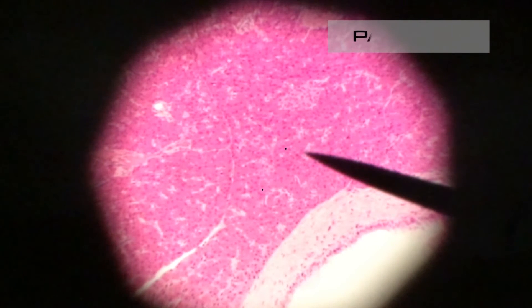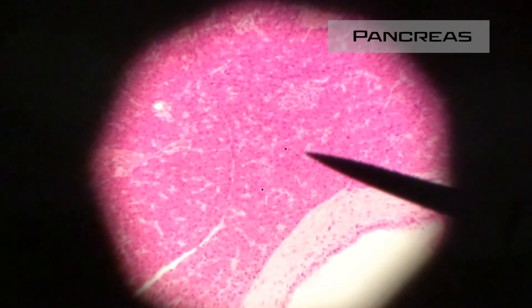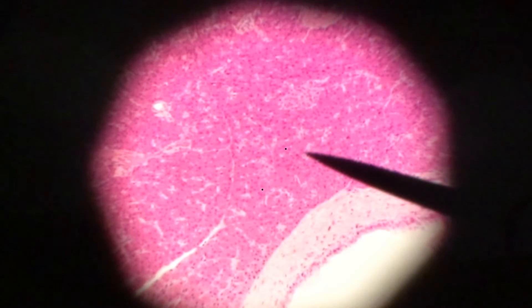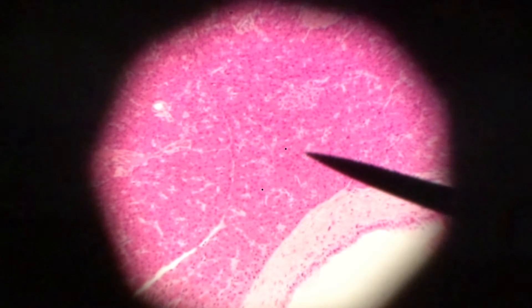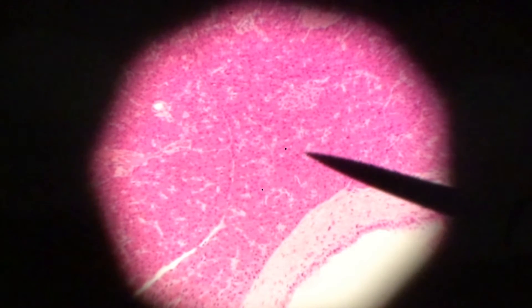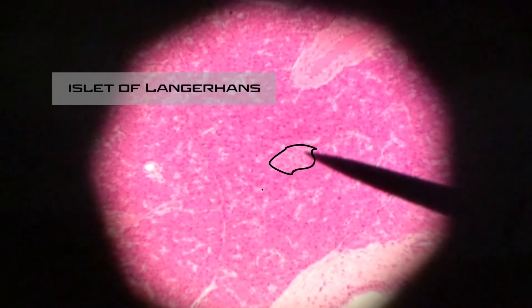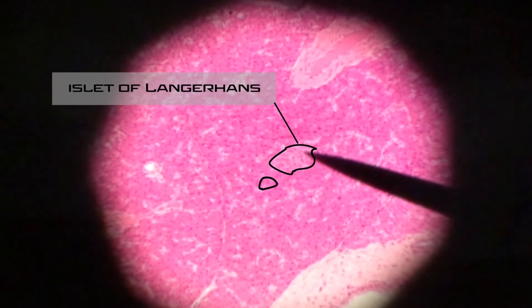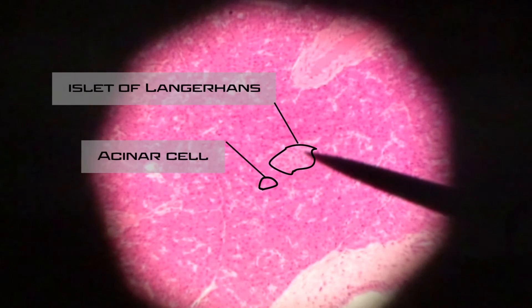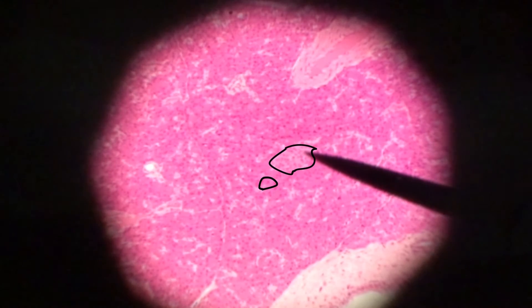Now we're going to look at a pancreas slide, focusing on the endocrine part of the pancreas. The endocrine cells are housed together in structures called islets of Langerhans — here's one, and there's another — they're usually lighter in color. The cells surrounding them are called acinar cells and are used more for digestion. This circle of lighter cells is where the endocrine cells of the pancreas are located.